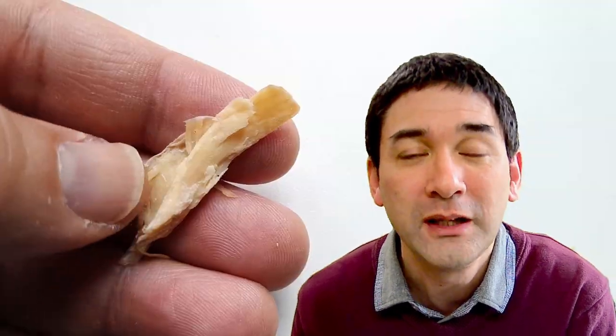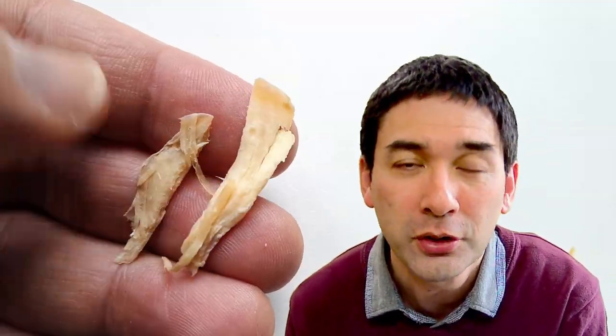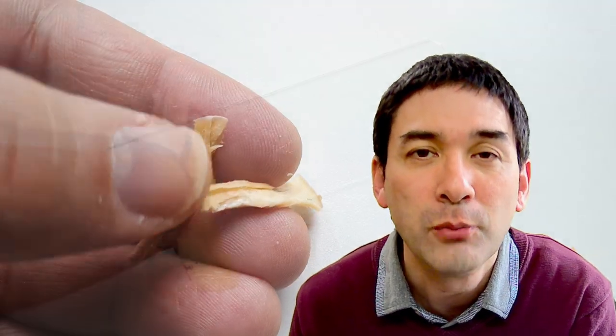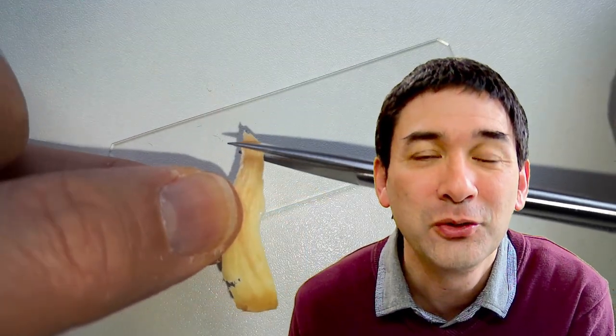If you want to put some muscle under the microscope, you really have to make sure that you pick it apart properly and put it into small pieces, otherwise you're not able to see the detailed structure. Everything has to be sufficiently small, and then under the microscope at a low magnification — that's what we see. It's a little bit messy.